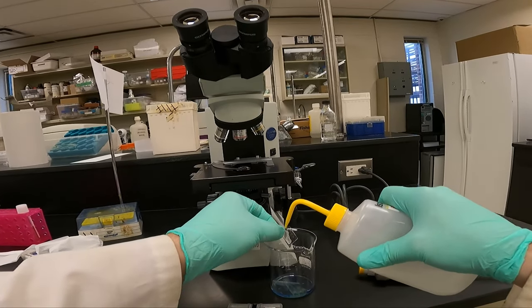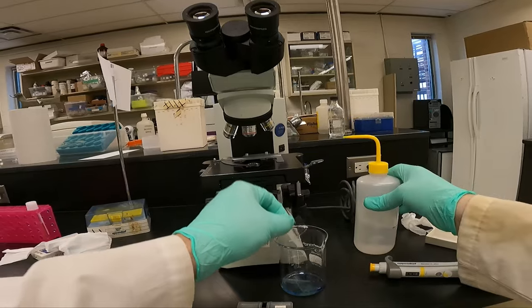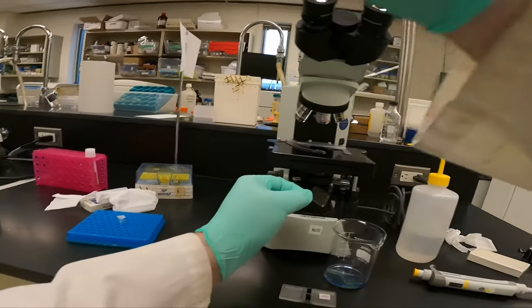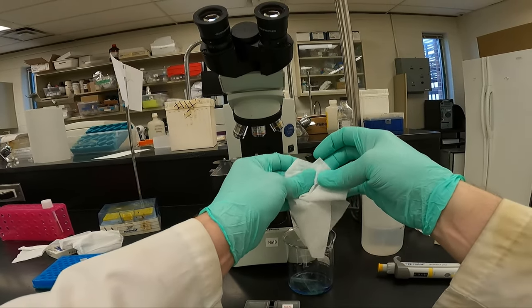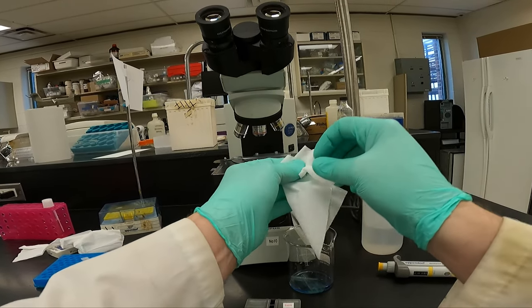Now remember, we're not done yet until we've cleaned up. So we'll take apart our hemocytometer, we'll wash the cover slip with some isopropanol, and wipe it down with a Kim wipe. Again, please be careful not to apply too much pressure. These slides can crack pretty easily.